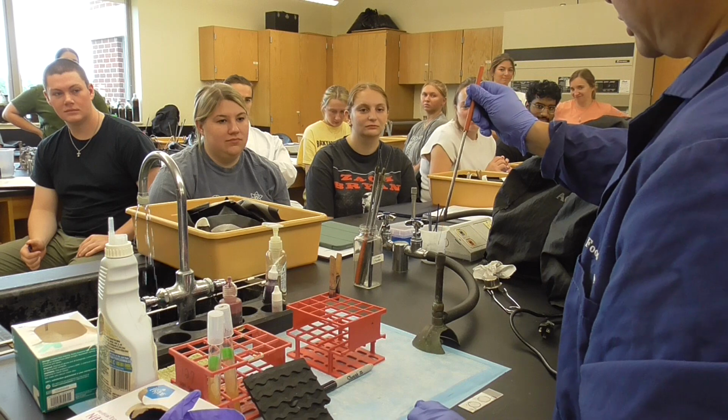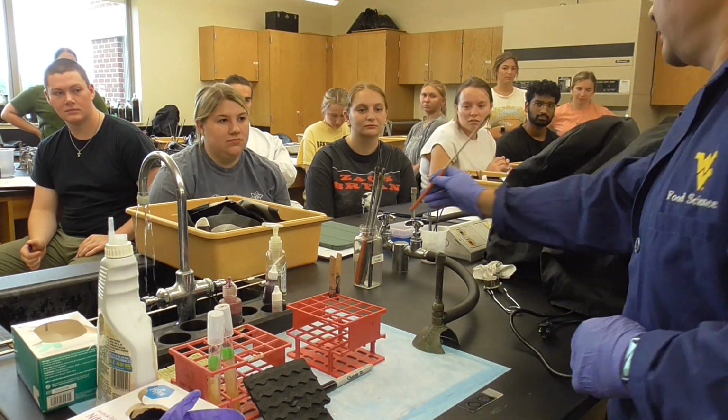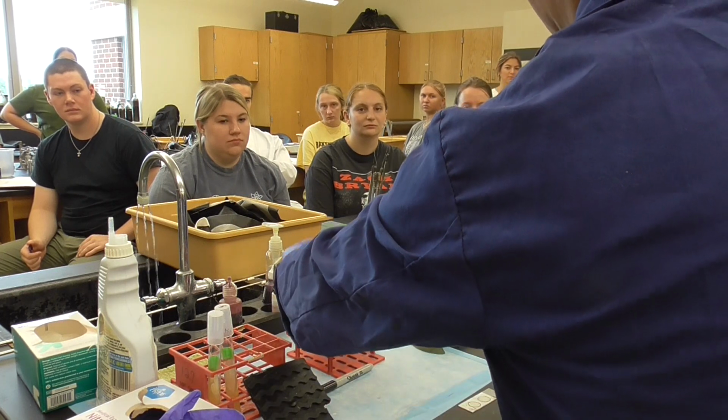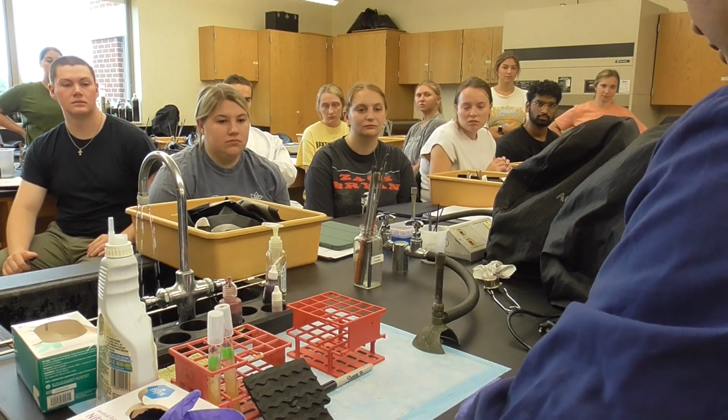Okay, now we flame it. Okay, so we put it back. Now once this is done, you're going to do the air dry. The air dry is about 3 to 5 minutes. So let's say the air dry is finished.